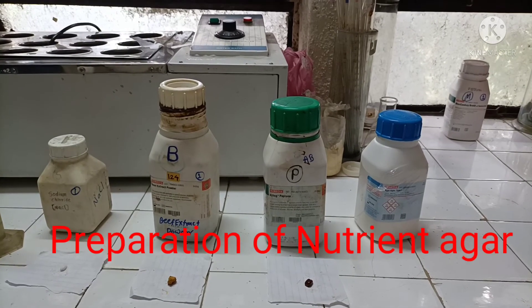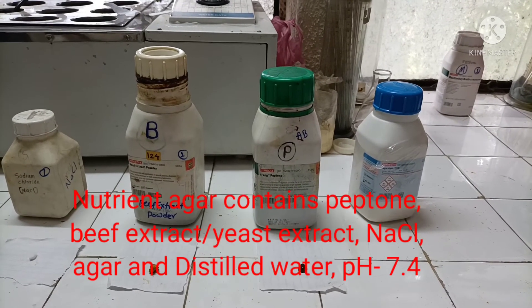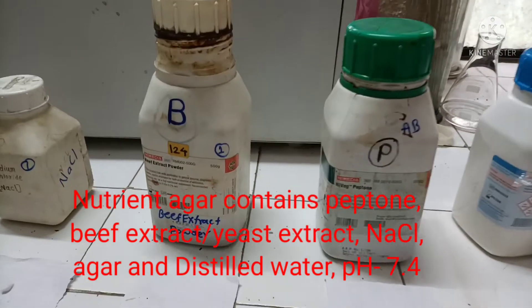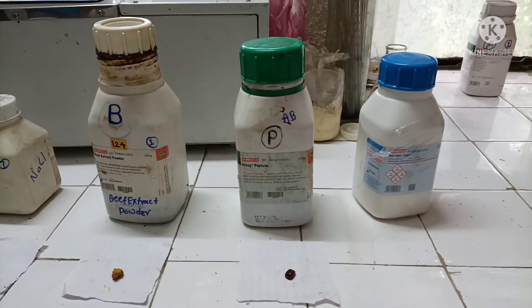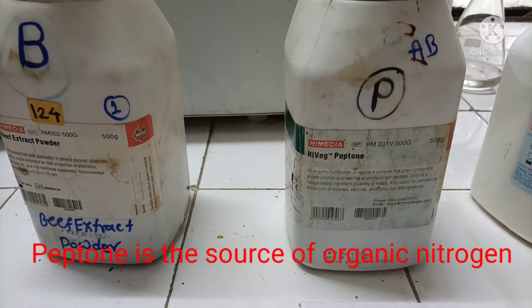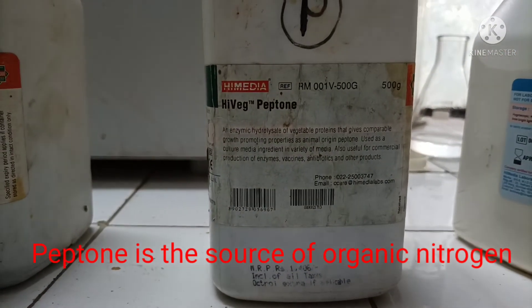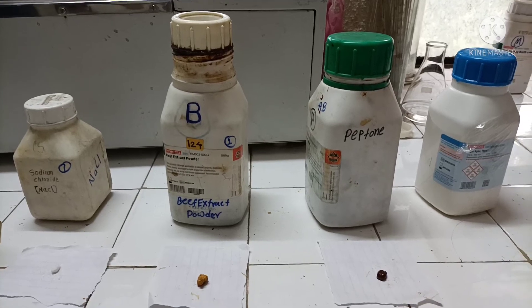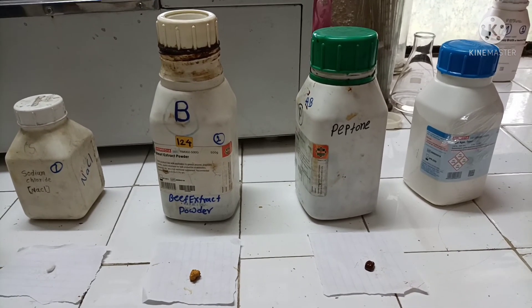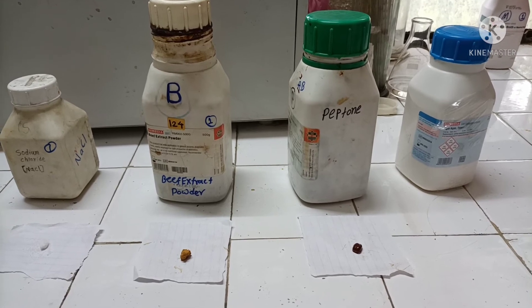Now we are going to see the method of preparation of nutrient agar. Nutrient agar consists of peptone, beef extract or yeast extract, sodium chloride, and agar powder. Peptone is the principal source of organic nitrogen for the growth of bacteria. The culture medium should contain all carbon sources, nitrogen sources, and elemental requirements to fulfill the requirements of the bacteria.